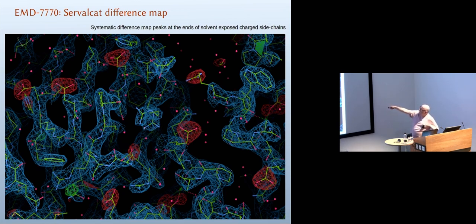scientists who are doing this rather pushed, I would have said, the exposure, wouldn't you? And so everything that's charged has just disappeared from the reconstruction. Now, you could argue that the B factor is wrong or the scattering factors are wrong, but even if I push up the density, push down the density level, there's not much there. It would be interesting to do a frame-by-frame reconstruction of this in the style of Chris.